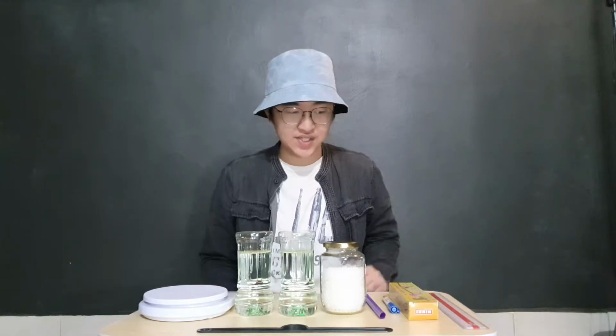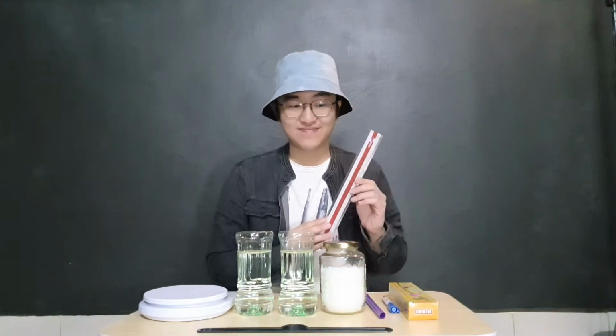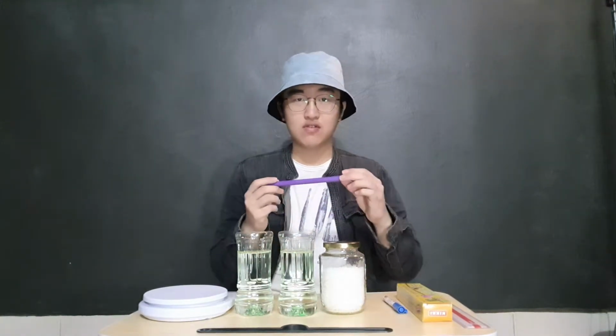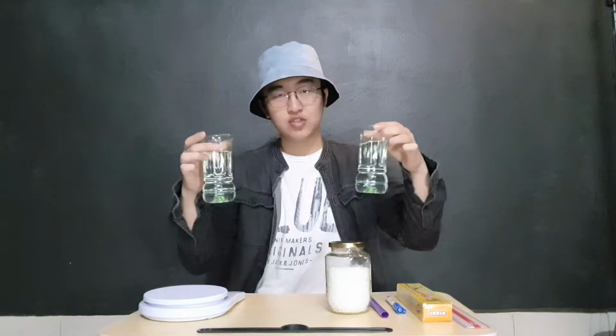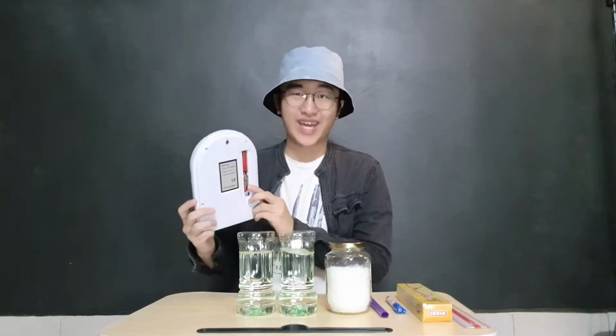Today, I'm going to teach you how to make a salinometer. First, let us prepare the ingredients. First, prepare a ruler, a modeling clay, marker, a straw, salt, water, 2 bottles of water, and also a weighing scale.